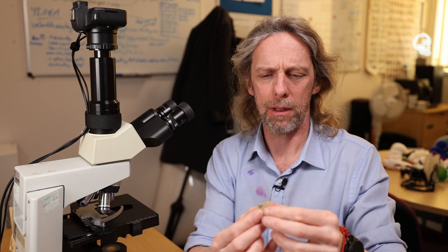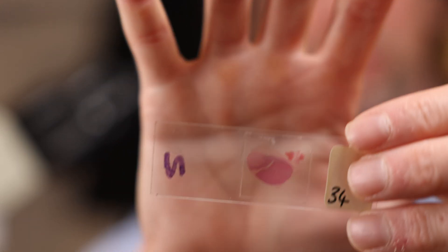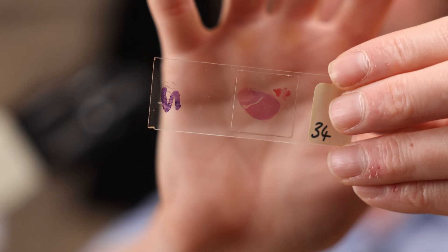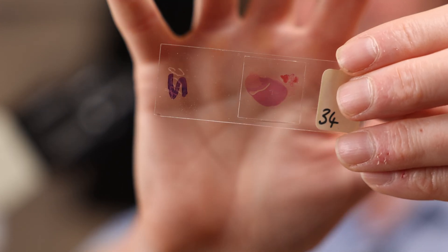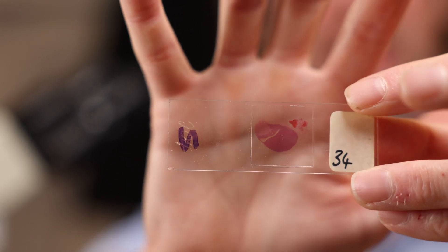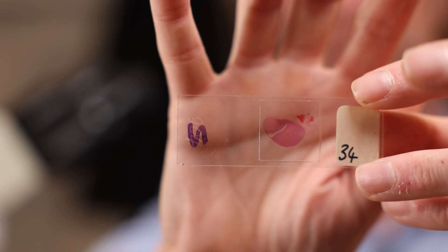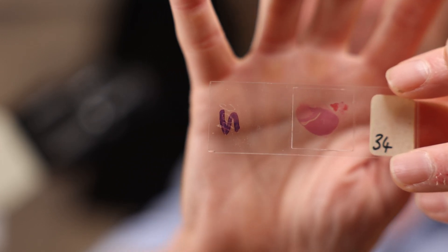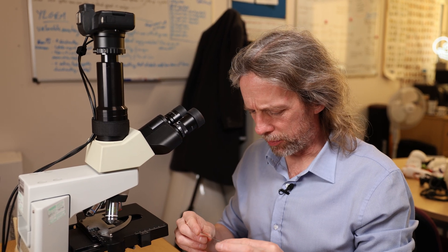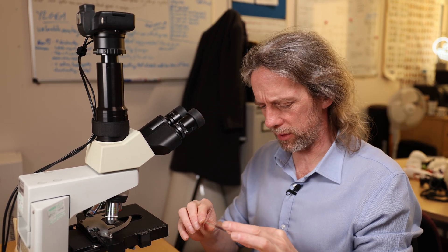I've got a section here — it looks quite big actually. It's a bit big to be from a mouse or rat, and I think it may be too big for a human. It looks like a more modern slide than some others in my collection, and it looks well stained — I think it's stained with hematoxylin and eosin. Let's have a look at the cells of the pituitary gland and talk about the parts, functions, and hormones.